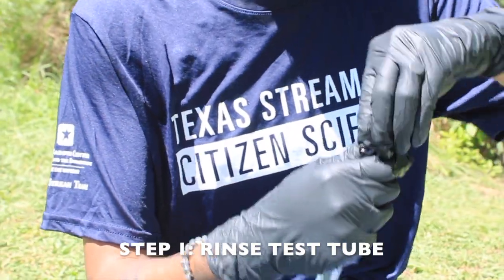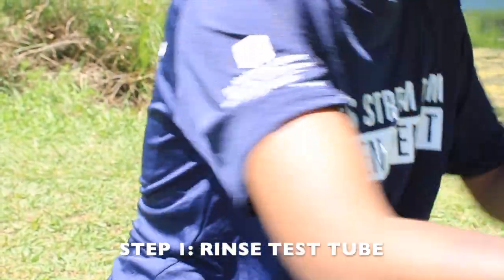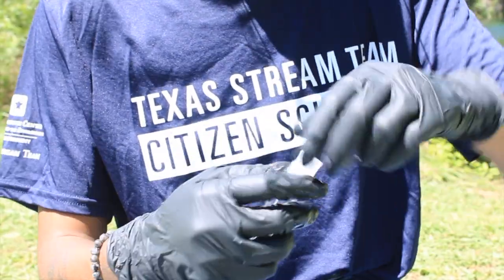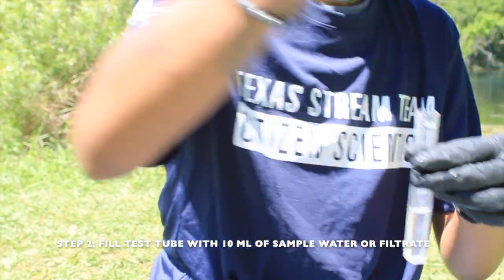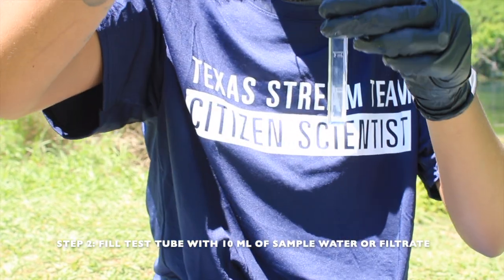For step 1, rinse a test tube and cap 2 times with sample water or filtrate if the water sample was filtered. For step 2, fill the test tube with 10 milliliters of the sample water or filtrate as appropriate.